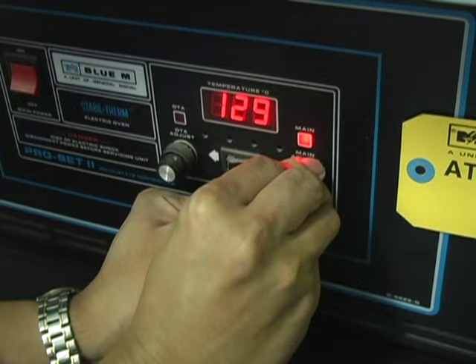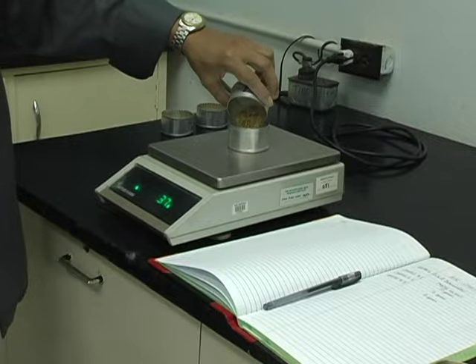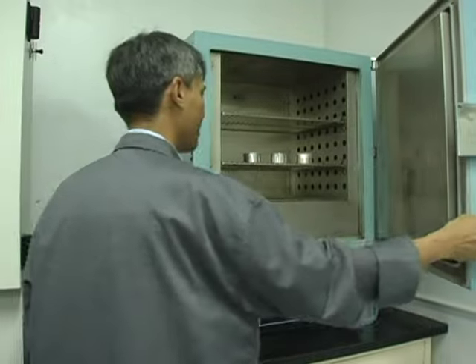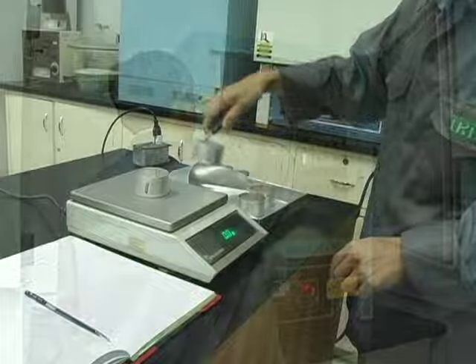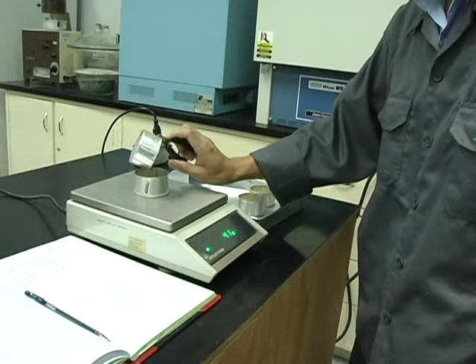You can use the oven method to test the moisture content when a moisture meter is not available, but you must use a temperature-controlled oven. You may also use the oven method to calibrate the moisture tester.